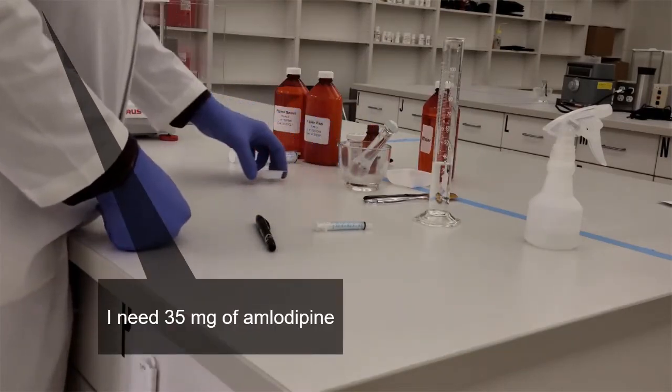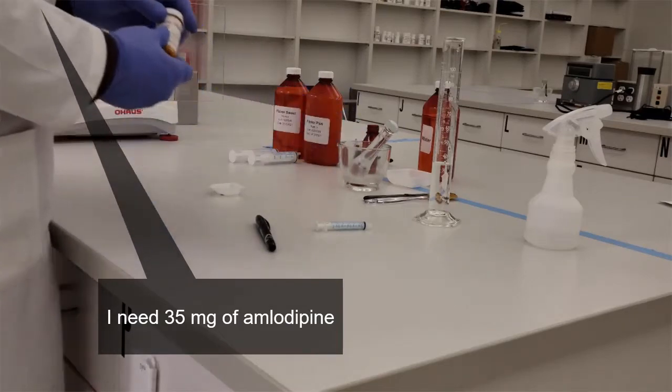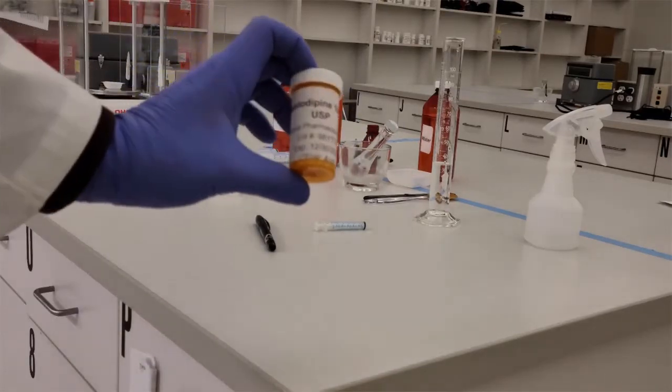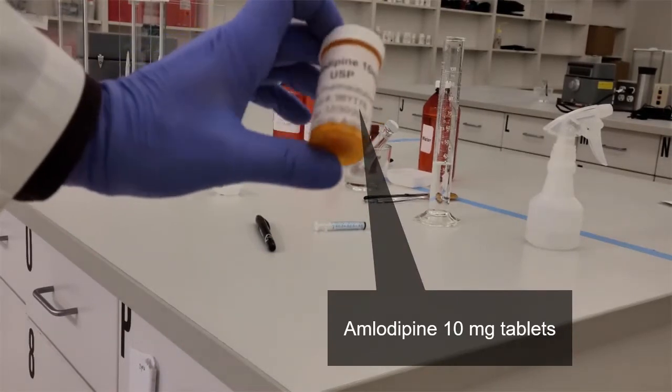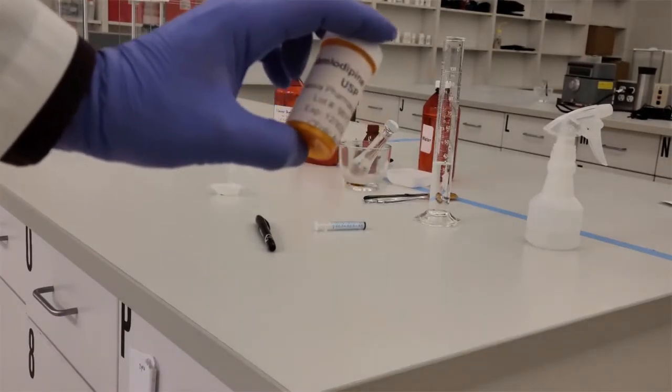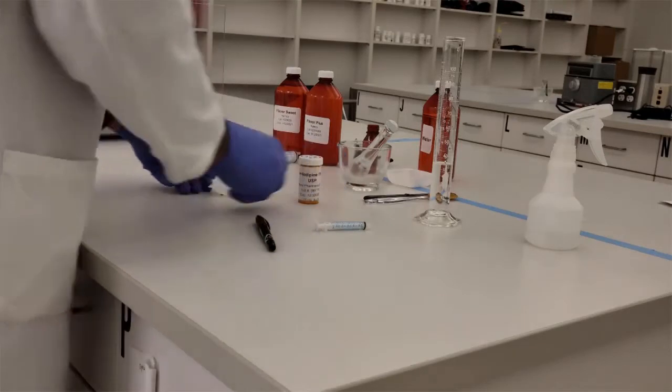So next, what I'm going to do is get my drug, and I need 35 milligrams of amlodipine. How am I going to get that? I'm going to use the source of the drug is amlodipine tablets. These are 10 milligram tablets.